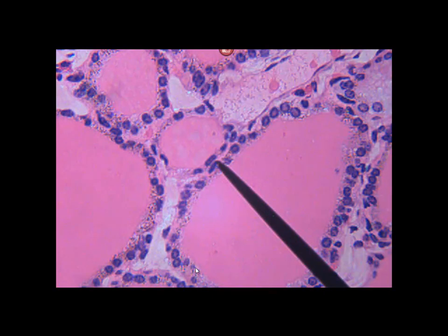Now, this little ring of cells that goes around that way, those are follicular cells. The pink stuff here is colloid. I know in our picture it was yellow, but that's the storage area for T3 and T4. And yes, this whole thing is a follicle, but the pink is colloid. The little ring of cells around it are follicular cells.